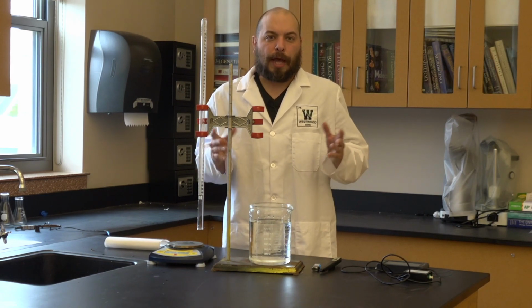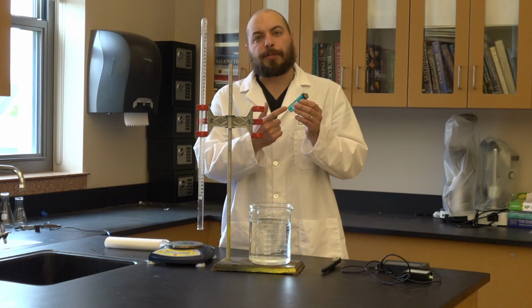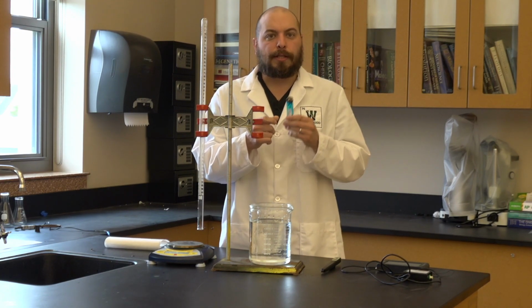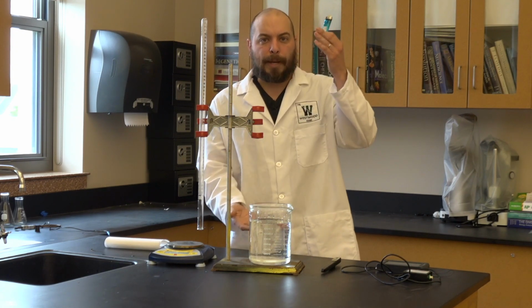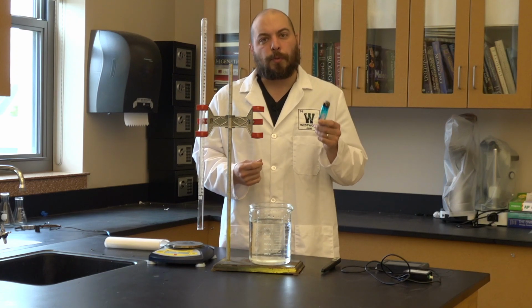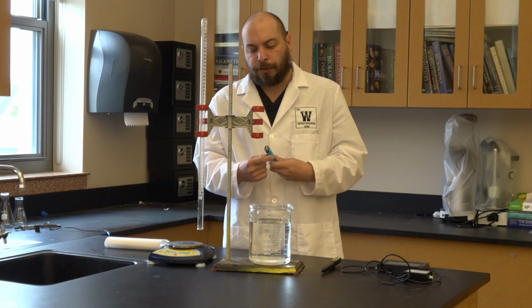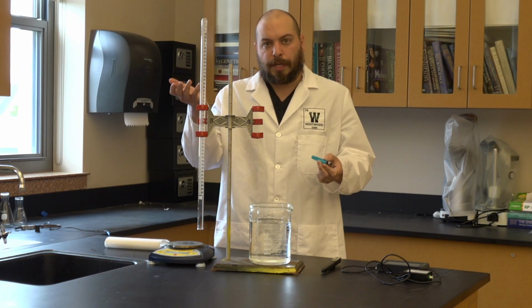All of this lab is predicated on one thing, the butane. We need to be able to get a precise measurement of butane, and we're going to be looking for the grams of butane that are released. Because in the end, we need to figure out the amount of butane released, and grams is the best way to do that. The way we're going to do this is, because the lighter is going to end up in the water, right? That's how we're going to release the butane into the eudiometer.